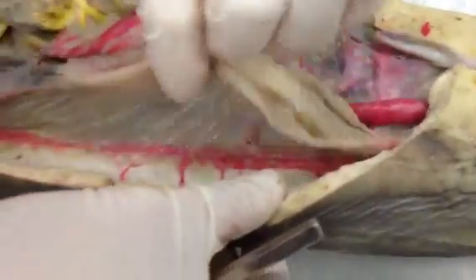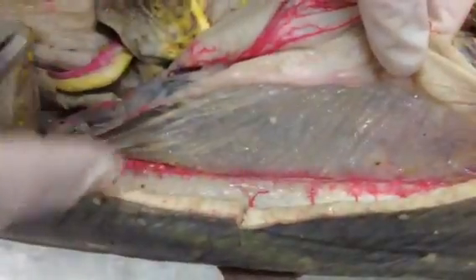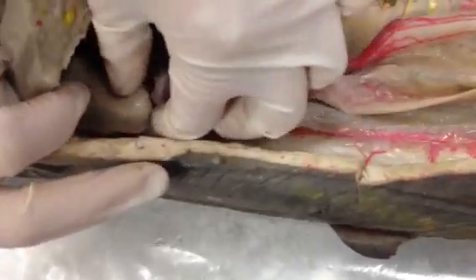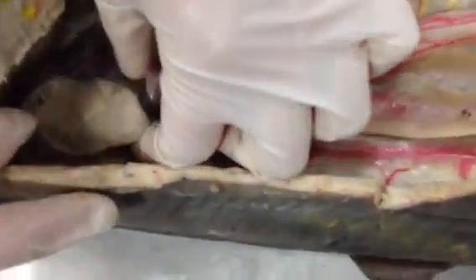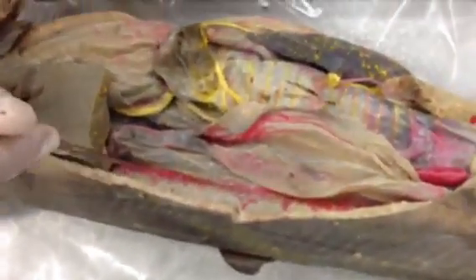For the subsidiary mesenteries, those are the ones for the sexual organs. For a female, the mesotubarium would be the one that anchors the oviducts to the wall, and for the ovary it's the mesovarium. Just know that the mesentery that anchors the ovary is the mesovarium. For the male, the mesorchium would be what anchors the testes to the wall.